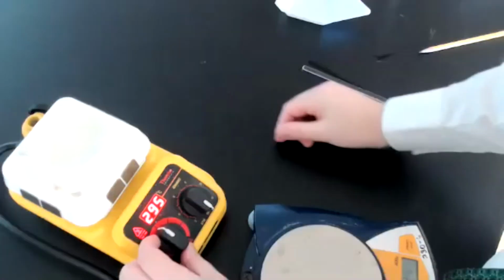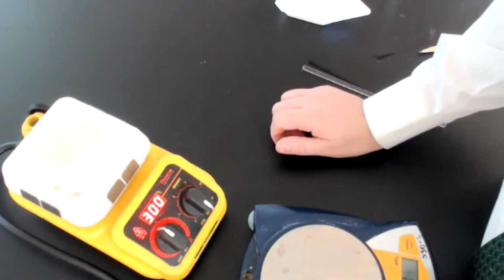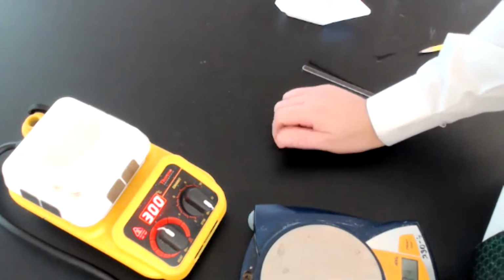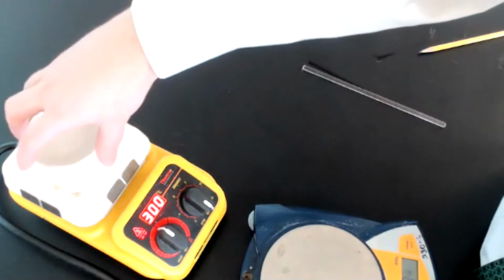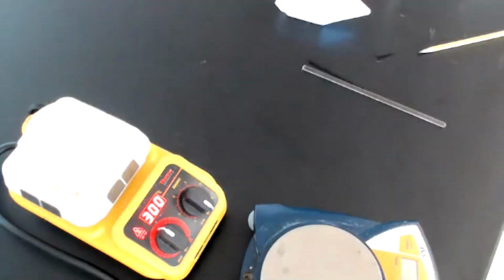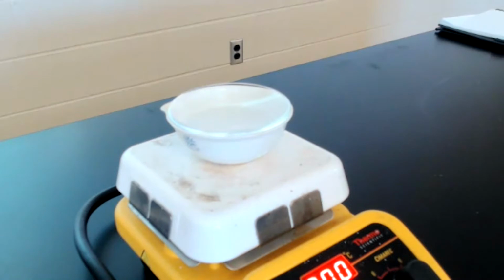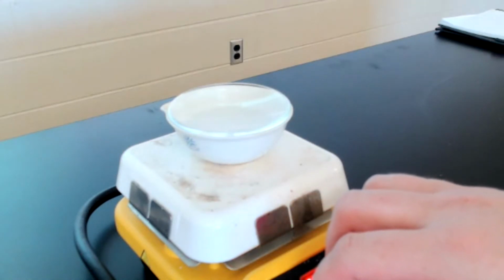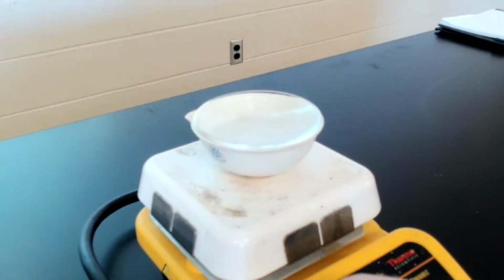Okay, so I'm going to once again turn it back on to about 300 degrees. Now I'm going to time lapse this for you, so that way you're not sitting here watching this the entire time. But wow, it almost looks as if it has disappeared, but I assure you that my evaporating dish and hot plate are there. Change the camera angle here so you can see it a little better. There you go. Okay, so I'm going to let that sit for a little bit. We're going to heat it up, and I'll time lapse this so you don't have to watch it. And when we're all done, I'll talk to you again.